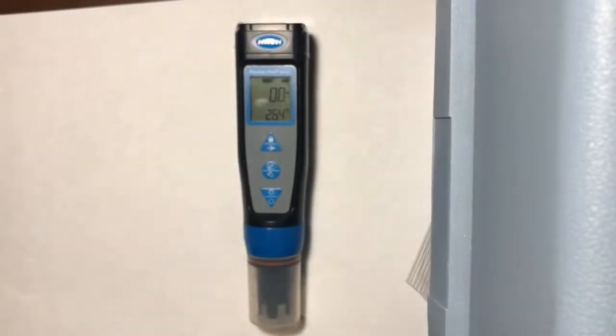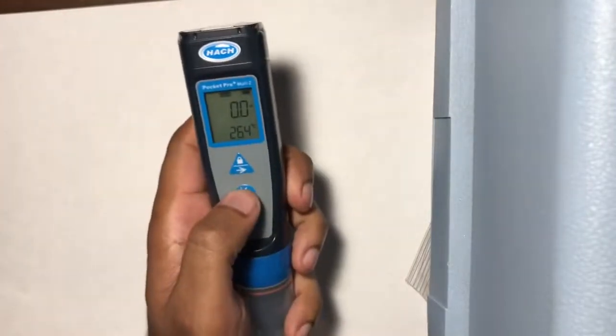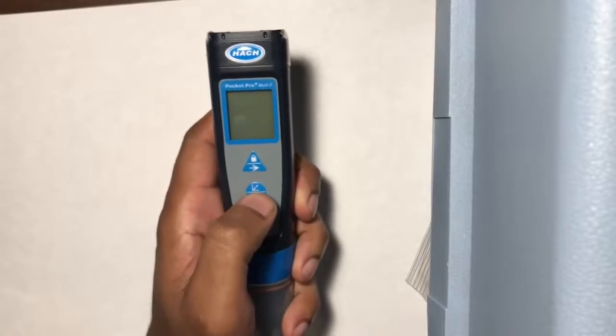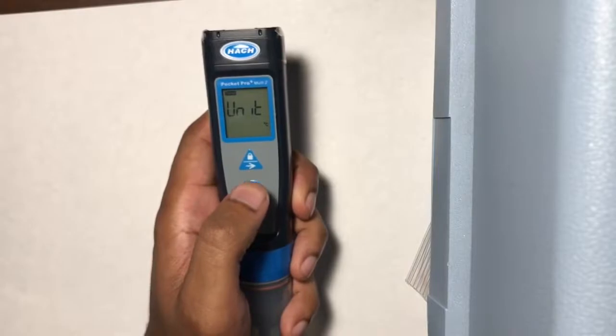We use the Hach with the baseline settings it comes with in the factory. You can change these settings using the middle button on the machine. You may have held the middle button while trying to reach the calibration mode instead of just tapping the middle button and reach the set menu. In this mode, you can change the units that each parameter displays when you're water testing.